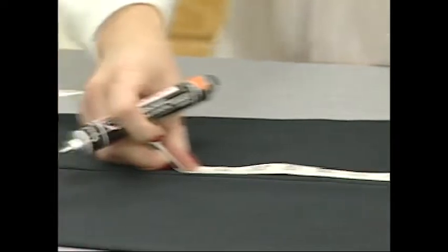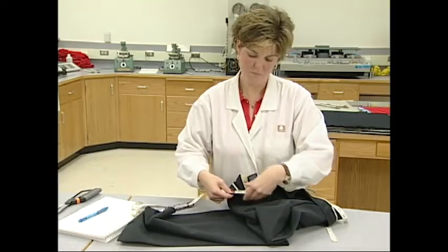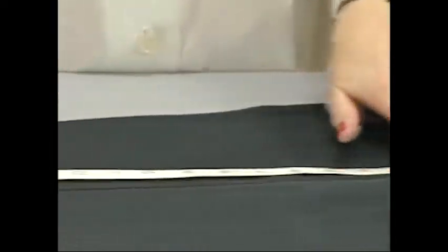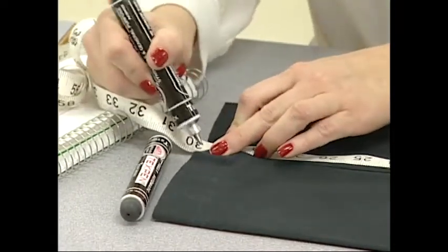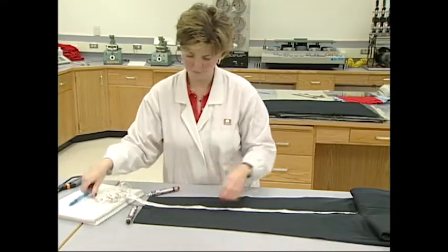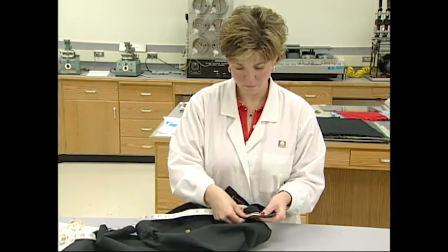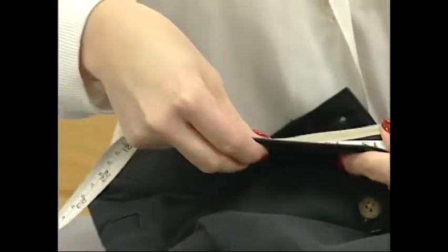Slacks or pants are measured in a different manner. The most common method is to get a length value for measuring the change in the inseam length. The width shrinkage is determined by measuring the waistband. For the length, the pants are spread on the table without distorting the garment. A mark is made at the top of the inseam where the pant leg joins the crotch, and the length is measured from this point down to the bottom of the inseam. The waistband is measured for width by carefully spreading it to eliminate folds and recording the width.